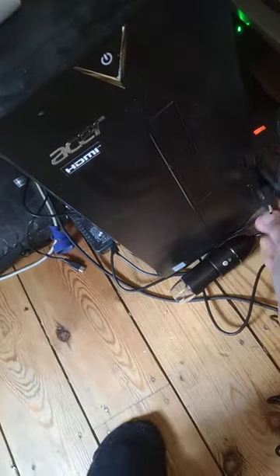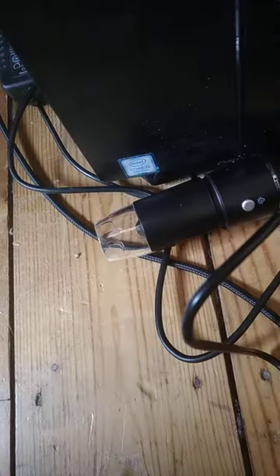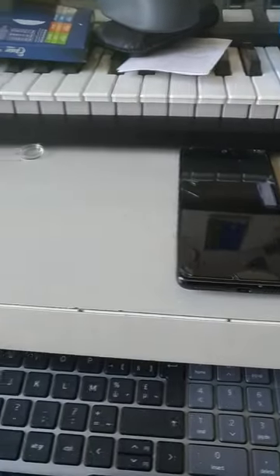So this is the. There we go. So you see it powers on. Okay. And now I'll put the USB-C. So here it is, and it's one slot above. There you go. Properly seated. And it's not powering on. Okay. Let me try another device. Try it on my other phone.